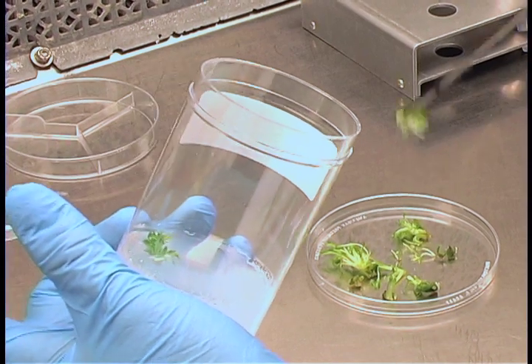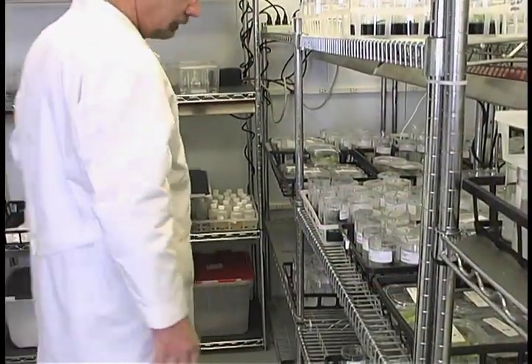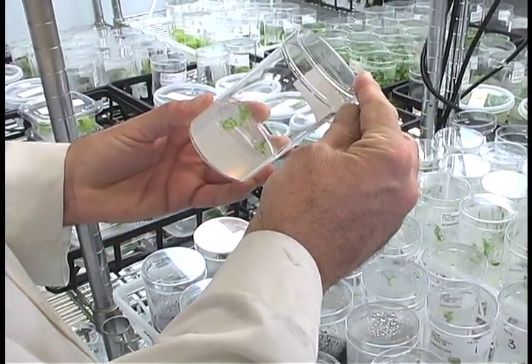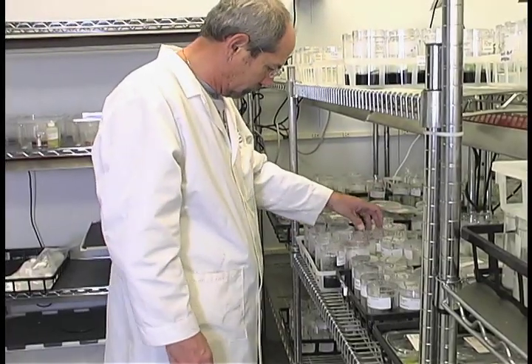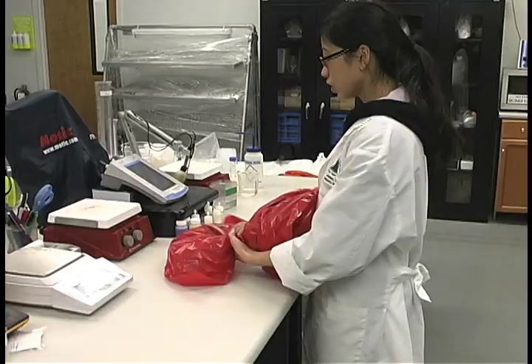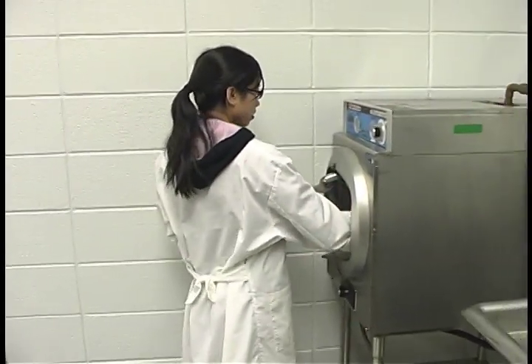By observing where contamination arises in a culture vessel, you may be able to determine the source of the contaminant. Check cultures every three to five days for contamination. Slimy areas mean bacterial contamination, while fuzzy areas are due to fungal contamination. Do not open containers that are contaminated — the contaminants could be harmful. The only safe way to dispose of these is to autoclave or pressure cook them for 15 minutes at 15 psi. Contaminated plastic dishes can be placed inside a large can or autoclavable bag to be sterilized before discarding.